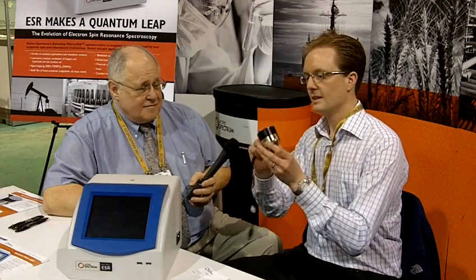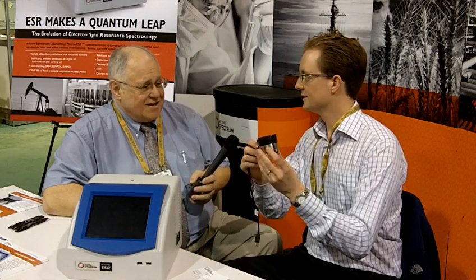for measuring free radicals and scale it down to the size of a hockey puck — and I've got one here in my hand. That's wild considering how big it used to be. This is a completely self-contained instrument.